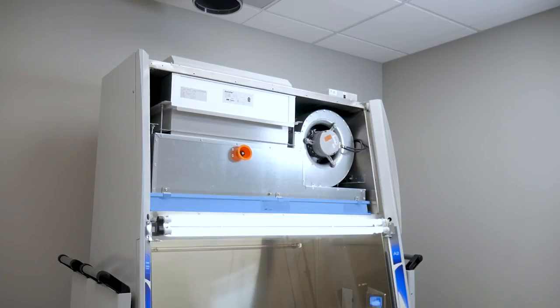Two HEPA filters, one that provides product protection and another that provides environmental protection as the cabinet returns air to the room or exhaust ductwork.